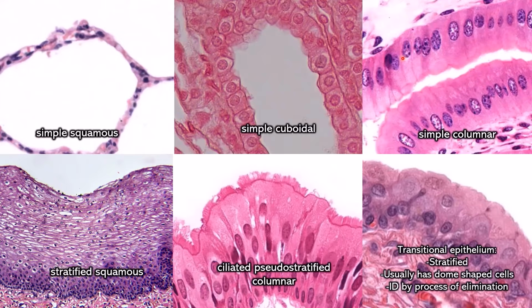This is stratified squamous. You see all those rows of nuclei, which tells you there's rows and rows of cells, therefore it must be stratified. And we name the tissue for the cells at the top. These cells are flat little pancakes. That is why it is stratified squamous, even though towards the bottom they do start to look more cuboidal. We don't care about that part.